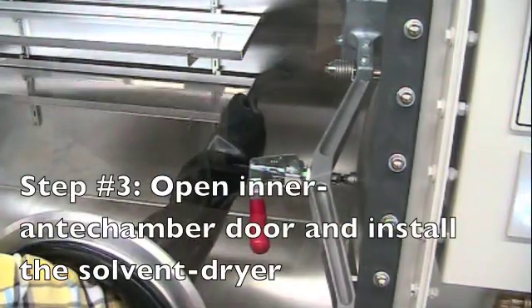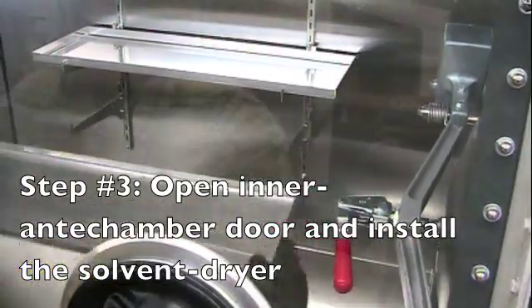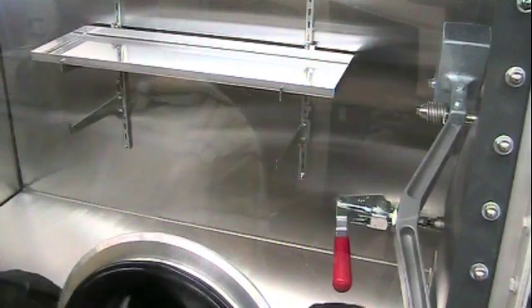Remove the lower shelf. The lower shelf brackets should be raised at least thirteen inches above the bottom of the box.